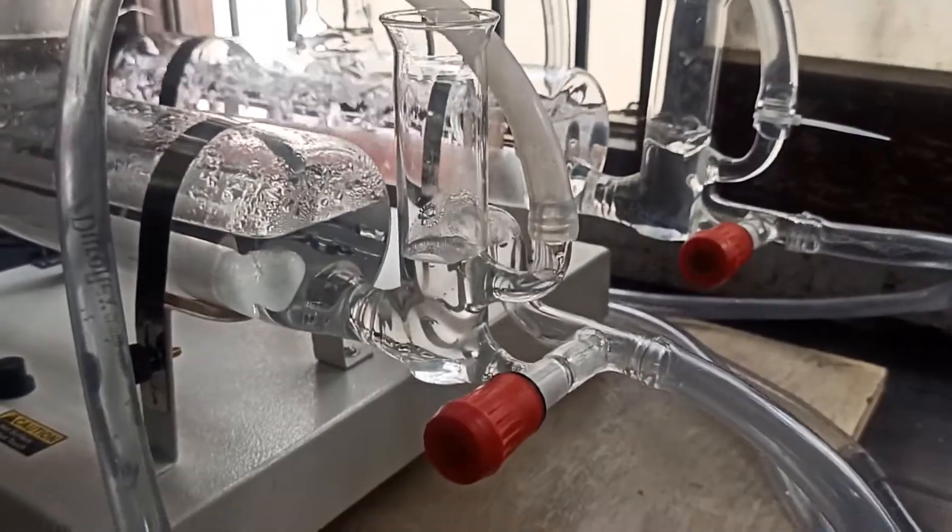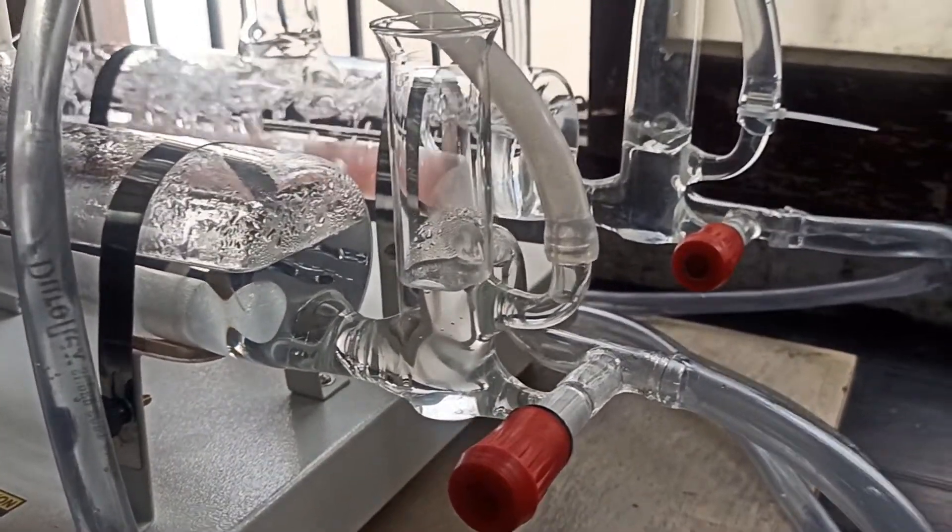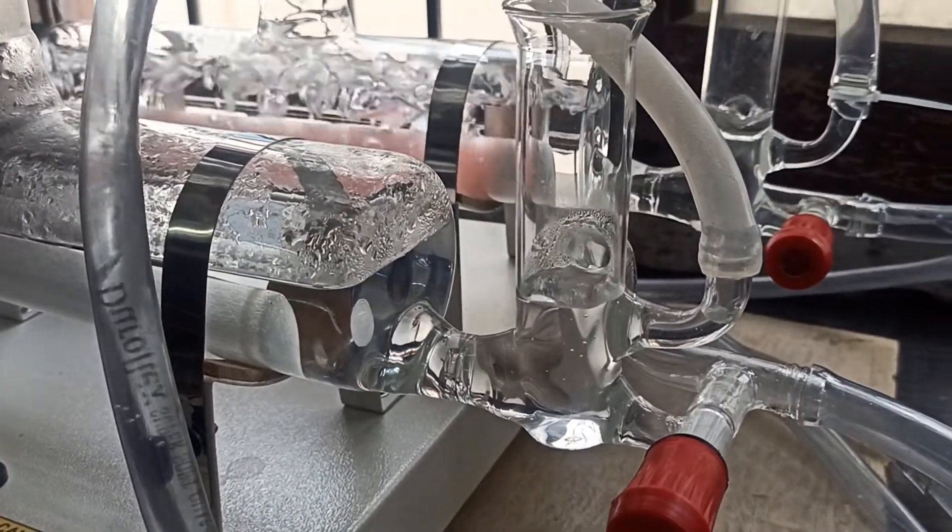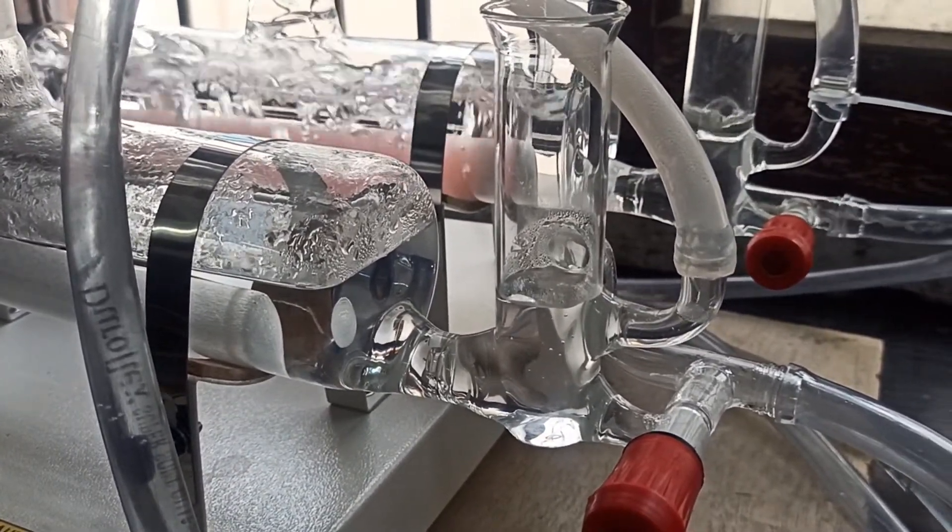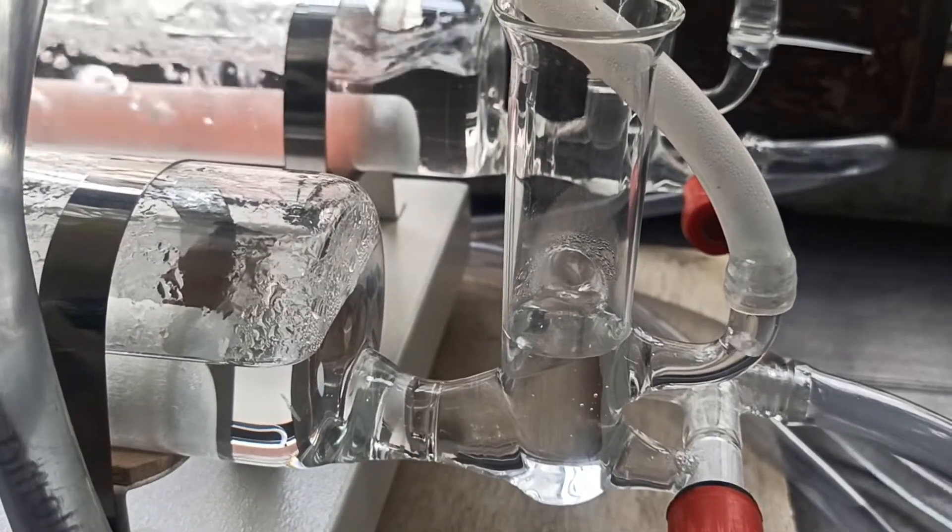When the boiling chamber of the second stage is filled with the first stage's distilled water, then you can see a few drops of water at the overflow point of the second stage boiling chamber.